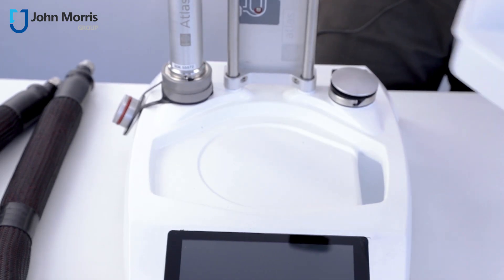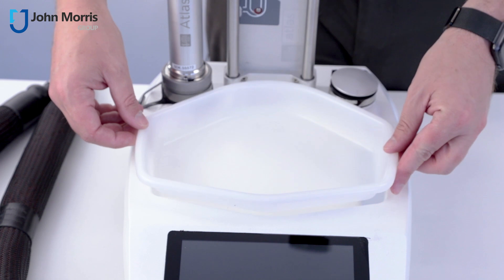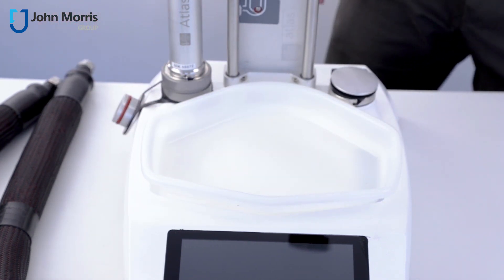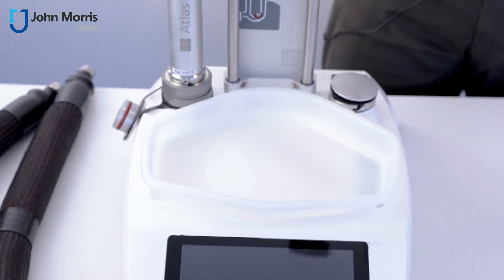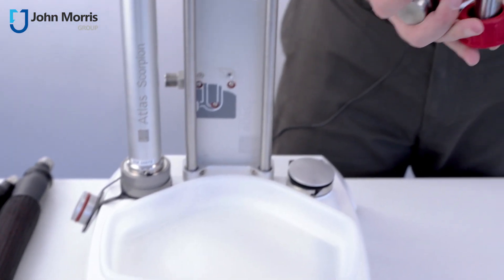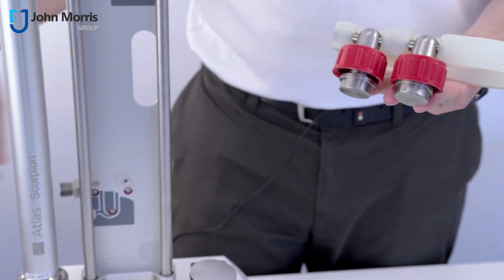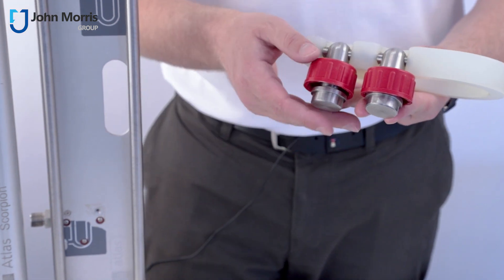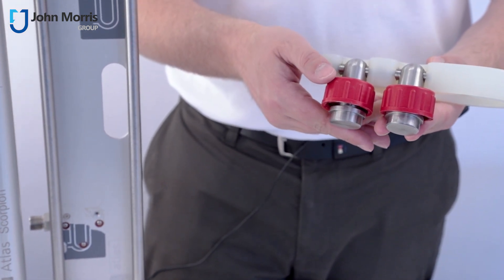We'll put the drip tray in place and now what we're going to put into position is a simple device to hold our tubes when they're not being connected to our jacketed reactor.